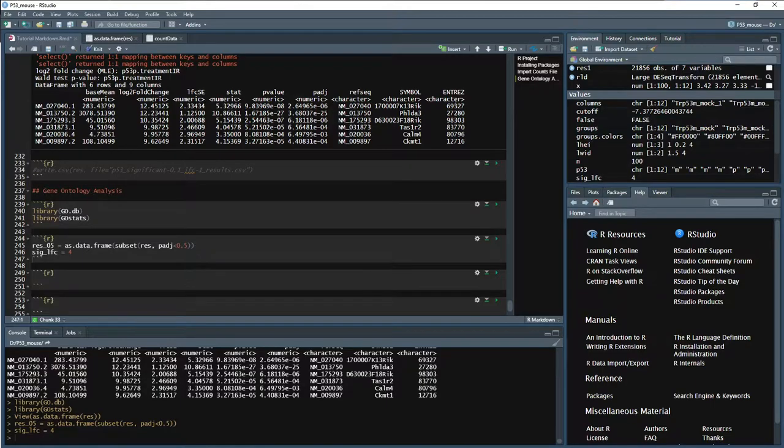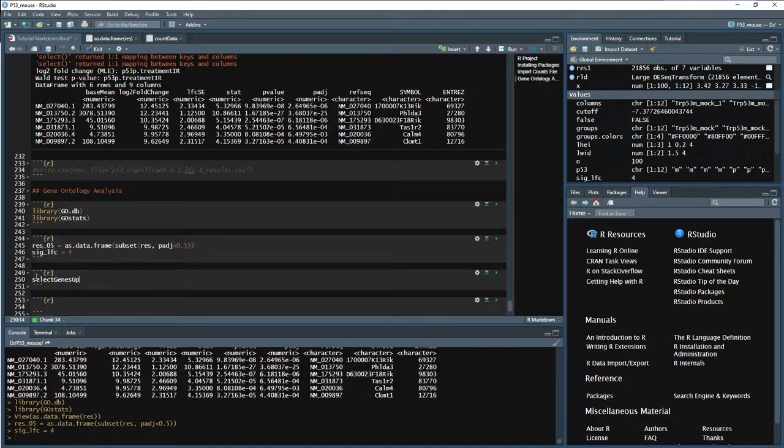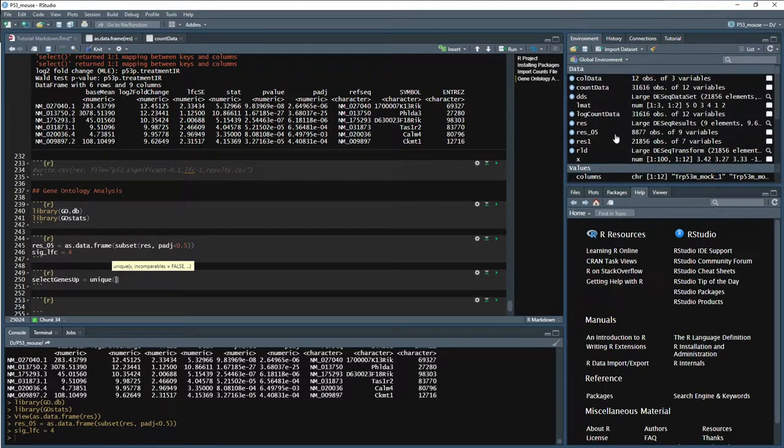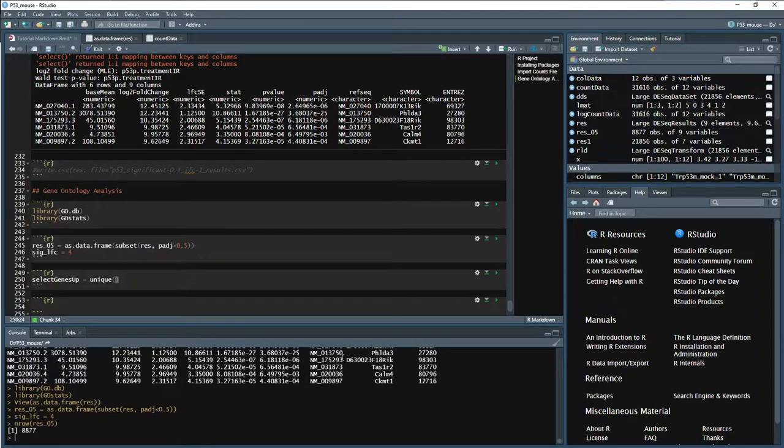Now, when we subset our genes based on whether or not they are upregulated or downregulated, we need to pull out the Entrez ID. So the Entrez ID is what the GO hyperG test is going to use in order to figure out which category or which term a particular gene belongs to. So this gets a little bit more convoluted, but it'll still work. We want to select our upregulated genes. So we can do genesUp equals, and we want to look at unique genes. So let's look at res05. We have 8877, so we have nrow of res05. But how many of those are unique? We do unique, and then res05 dollar sign entrez.